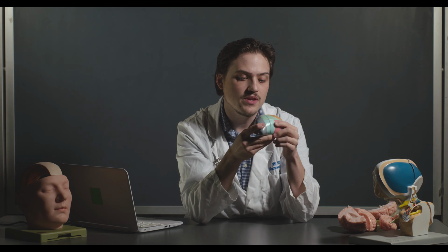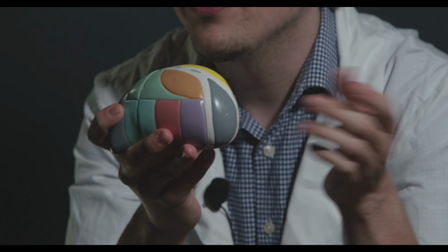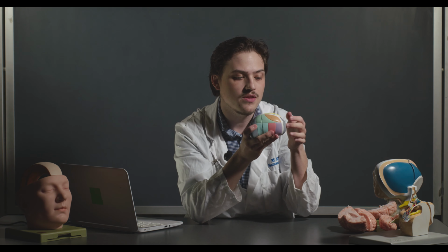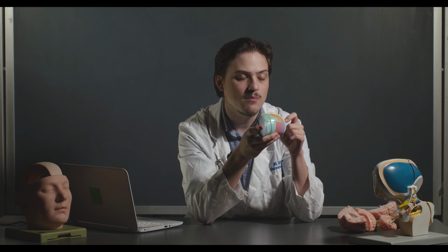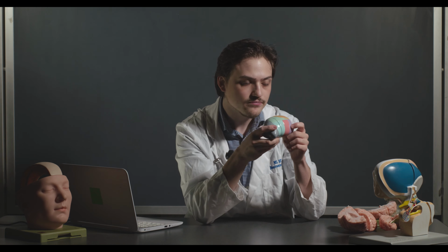So there's a couple of different nuclei that you should be able to identify. The first is the anterior nucleus. This is this guy right in the front. So anterior, right? So this would be essentially the nose. And this is the anterior-most portion of the thalamus. So it's called the anterior nucleus. Its function, in case you were interested, is actually one of the relay stations for memory. You actually have tracks that are coming from the mammillary bodies, one of the nuclei of the hypothalamus, that come and synapse in the anterior nucleus through the mammillothalamic tract, something that we'll talk about a little bit later.